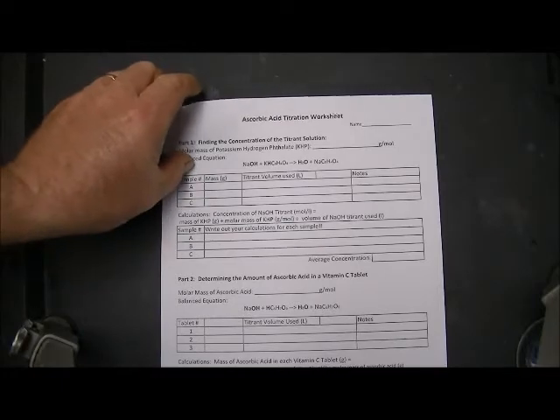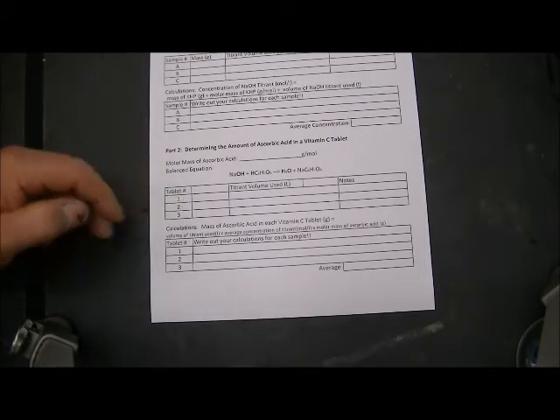This video is to help you complete the worksheet on quantitative analysis of vitamin C by acid-base titration. We will be analyzing the vitamin C content of three commercial vitamin C tablets. Vitamin C has the chemical name of ascorbic acid. The upper part of this worksheet determines the concentration of the titrant we have prepared. The bottom half uses that concentration to determine how much vitamin C is in your three tablets.